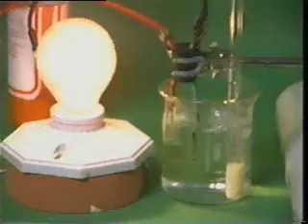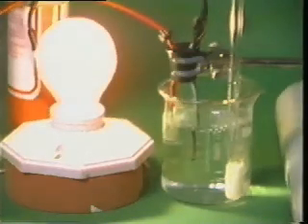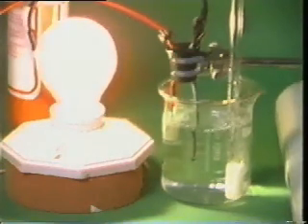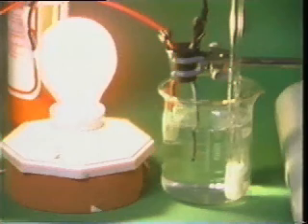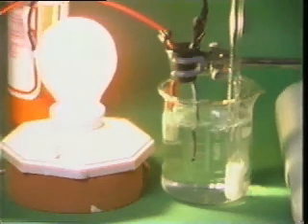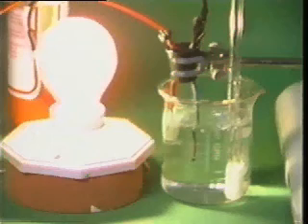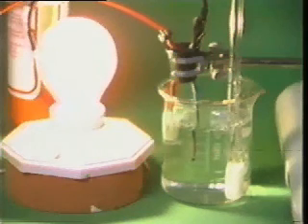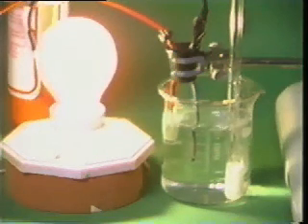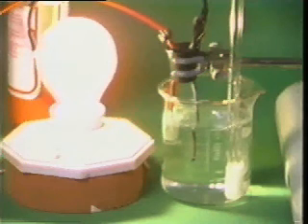When hydrogen chloride gas passes into the water, it dissolves and the bulb shines very brightly, showing that the solution is conducting. Ions form because water behaves as a base, accepting protons from the hydrogen chloride. We get the hydronium ion and the chloride ion.